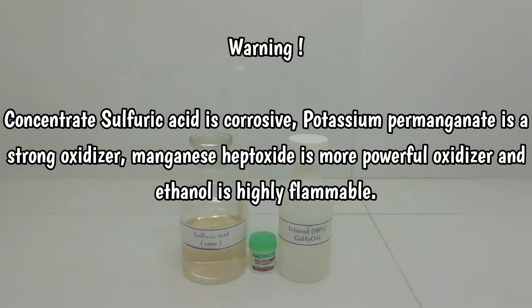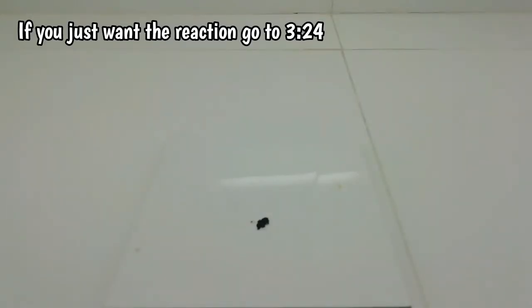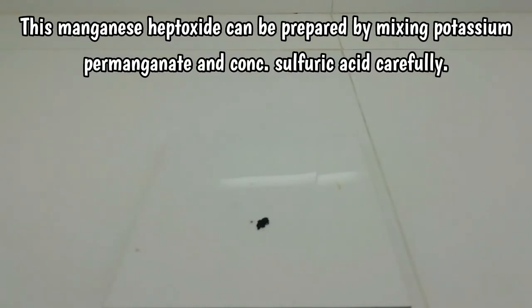Basically what we are going to do is make manganese 7 oxide. We also call this manganese heptoxide. Before going to the experiment, let me show you how powerful this manganese heptoxide is.